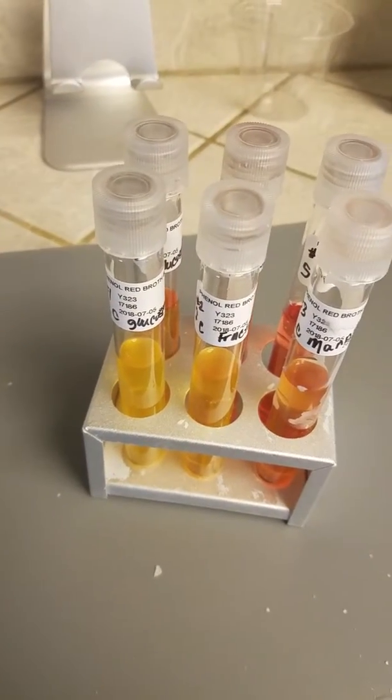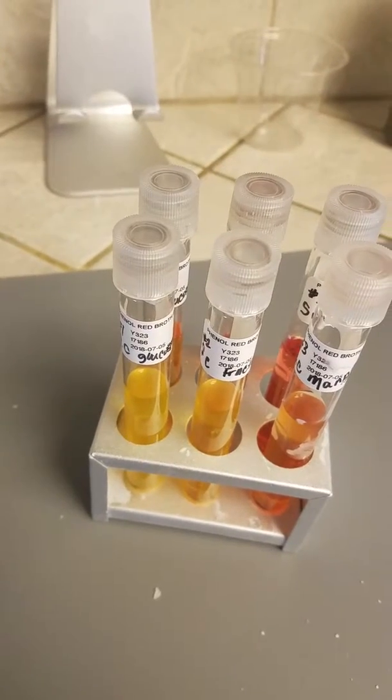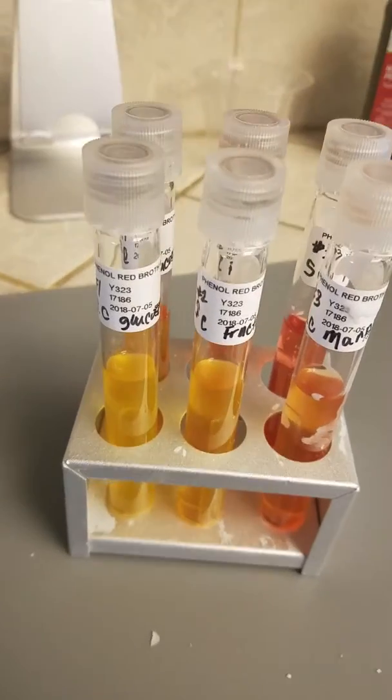Hi there, this is Denise Hayes. It is Wednesday, April 4th and I'm here doing the biochemical testing for microbial identification. This is the carbohydrate fermentation testing.